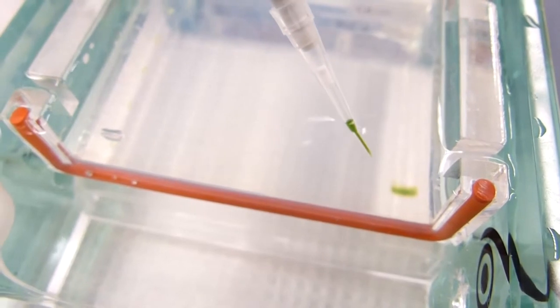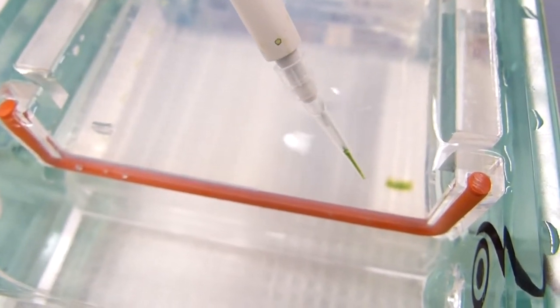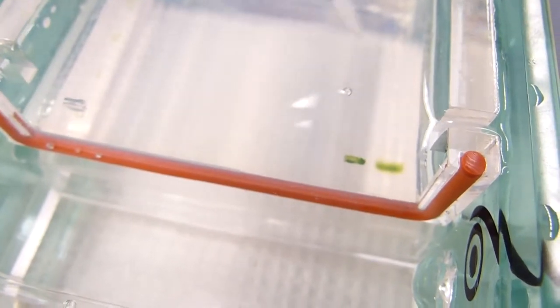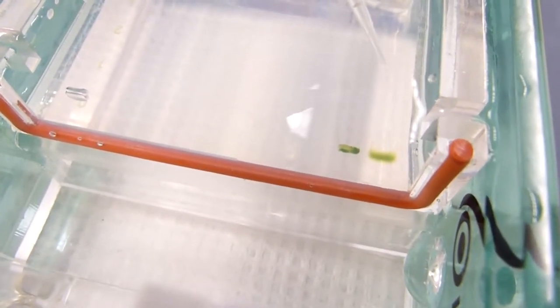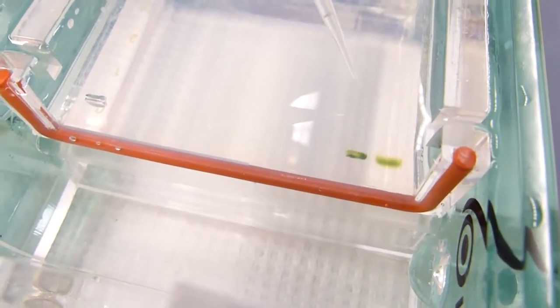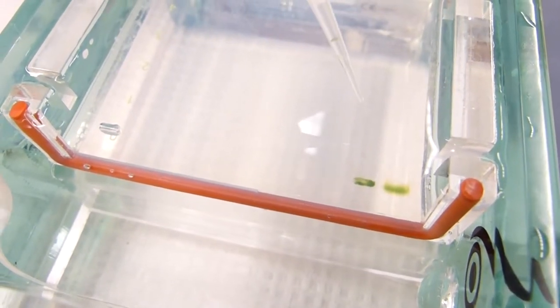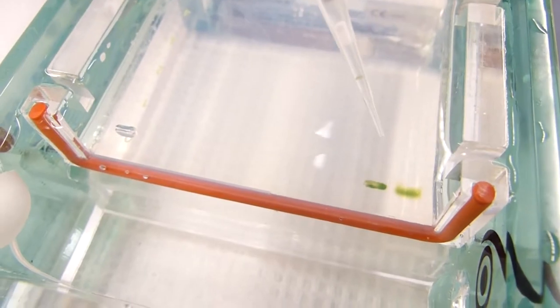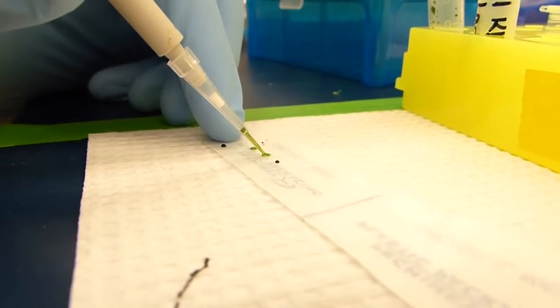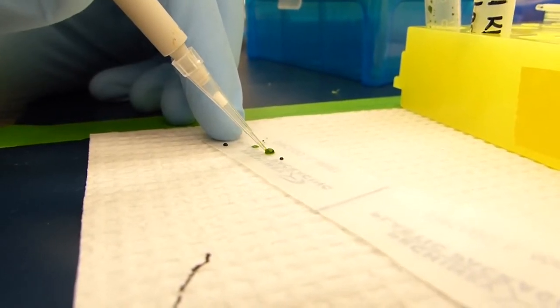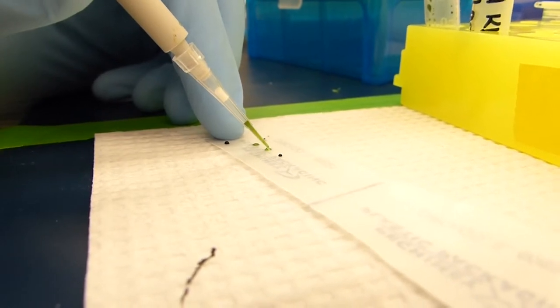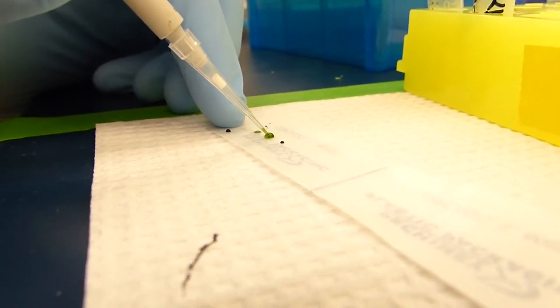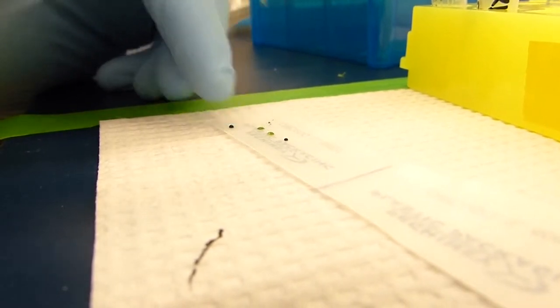You want to place your first DNA sample in the second slot. If you are working with samples that are not numbered or you want to remember the order of, you will want to make sure to write down the order that you put your samples in. Our samples are numbered 1 through 6 which makes it easier. Repeat this process with the rest of your samples making sure not to reuse dye dots and making more aliquots of dye if you need more.